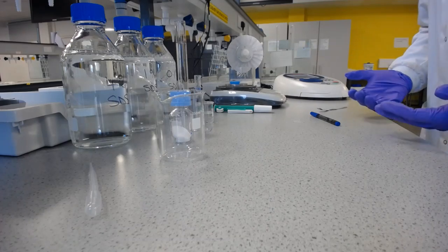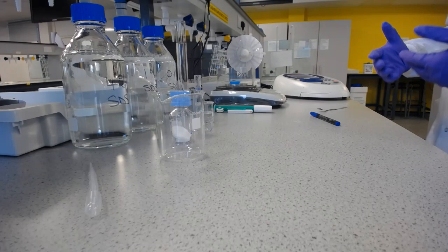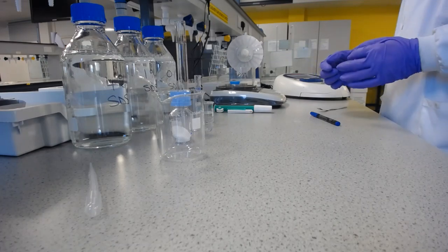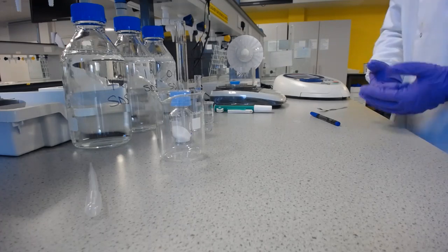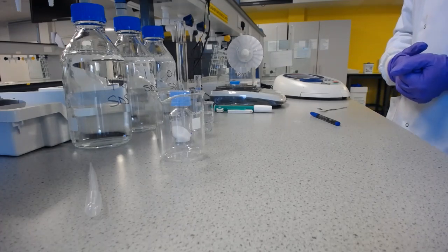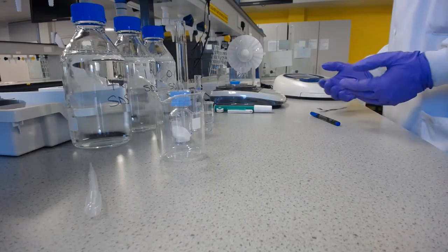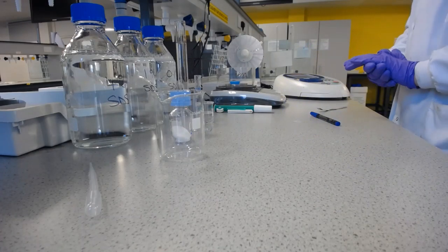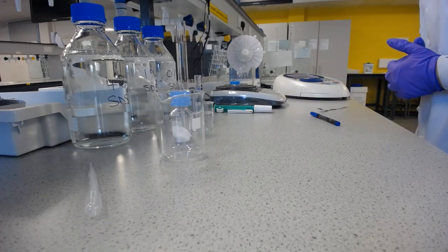And then we'll take some of that known concentration and we'll dilute it by a set amount. And we'll have a second known concentration. And then we'll mix that up and then do the same process again. We'll take some of that and dilute it with a known amount of water, and then we'll have a third known concentration of aspirin in water. So we'll do that 4 or 5 times, and then we'll have all of the concentrations we need, having only weighed out once. And that's called a serial dilution.